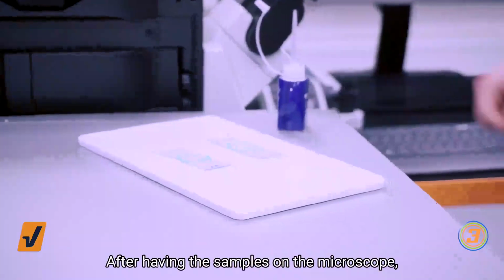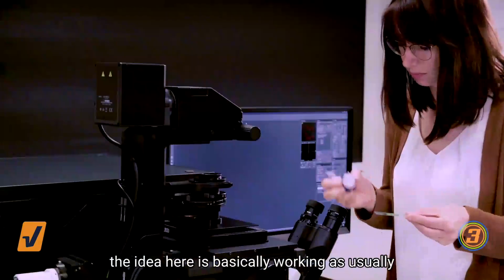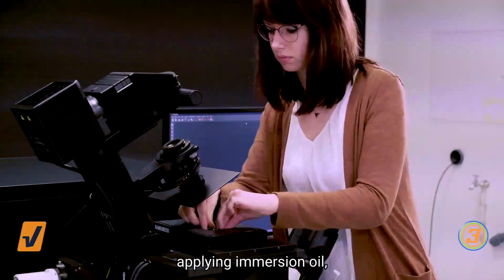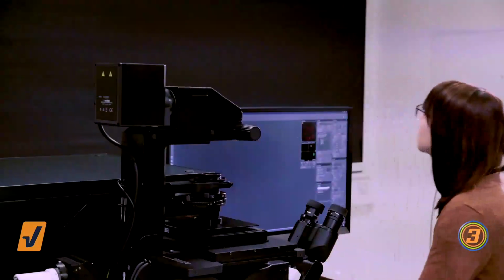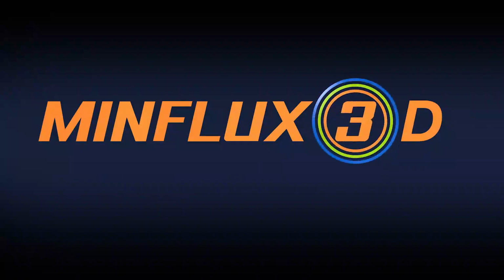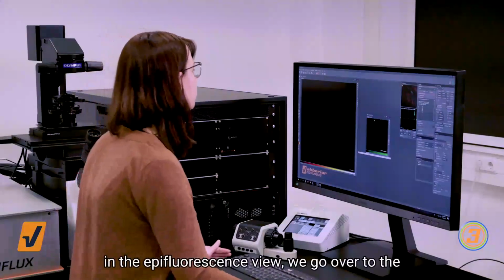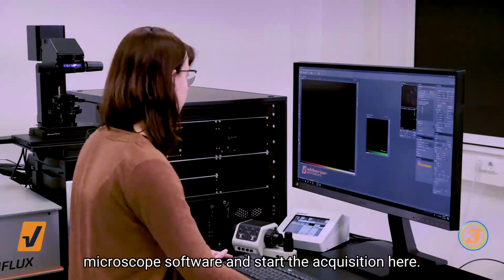After having the samples on the microscope, the idea here is basically working as usual in microscopy. You take the sample, you apply immersion oil, then you mount it as in every other microscopy technique, so nothing special. After checking the position of the sample in the epifluorescence view, we go over to the microscope software and start the acquisition.